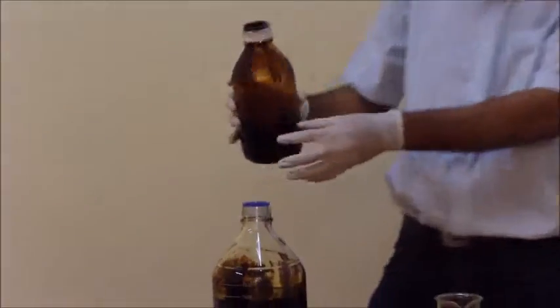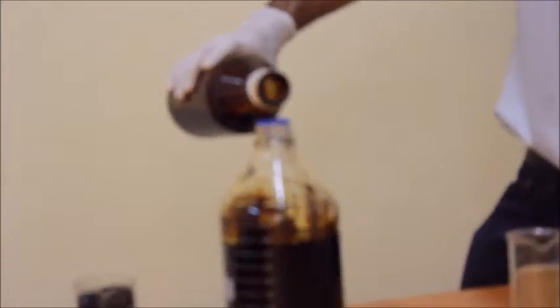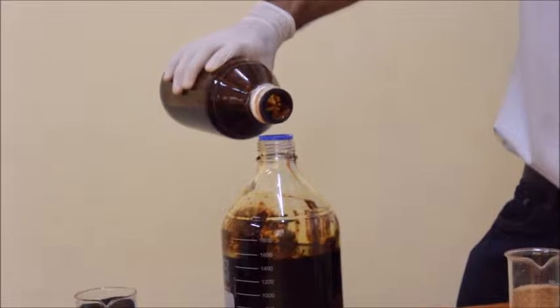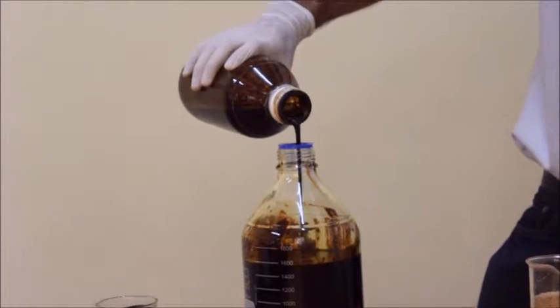Now that you guys have a look, you see the sample. Okay, have a look at it. This is Bio-Oil.